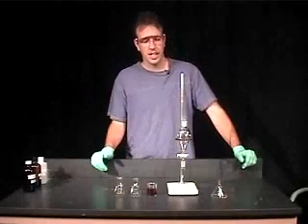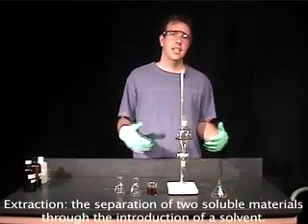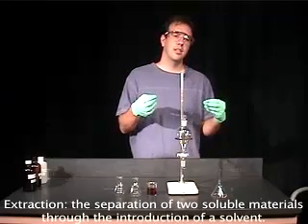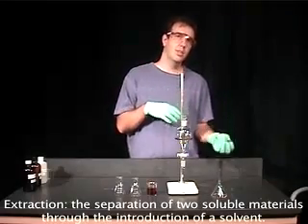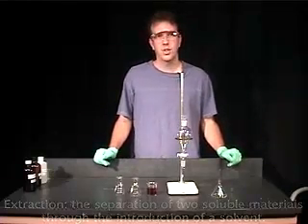In this video, I'm going to show you the technique of extraction. Extraction is a technique that allows you to separate material. It can be two liquids or two solids from each other. They have to be soluble in some kind of solvent.